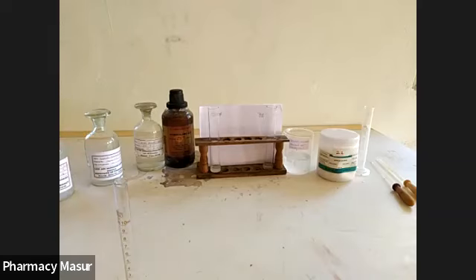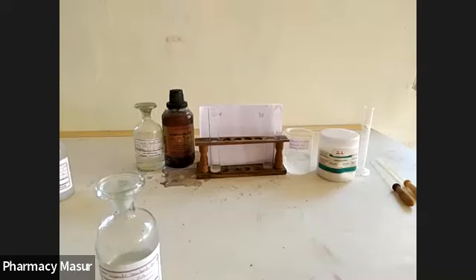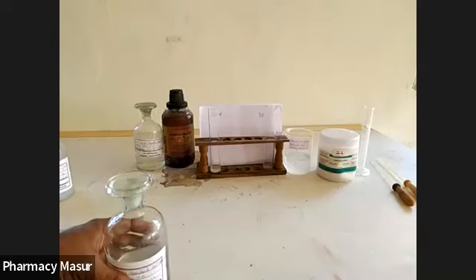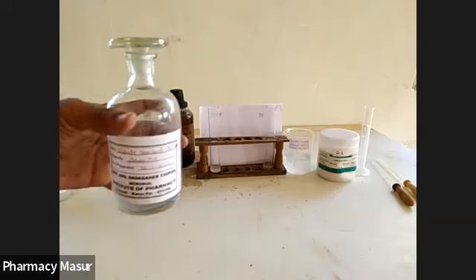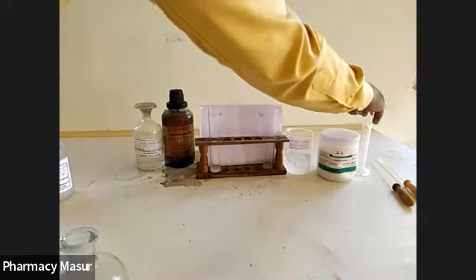Don't mix this pipette here and there. Okay. So after 1 minute, we have to add 15 ml of sulfate standard solution, which is prepared here, and the concentration of this sulfate standard solution is 10 ppm. That means it contains 10 ppm sulfate in it. So add 15 ml of this into the standard first.